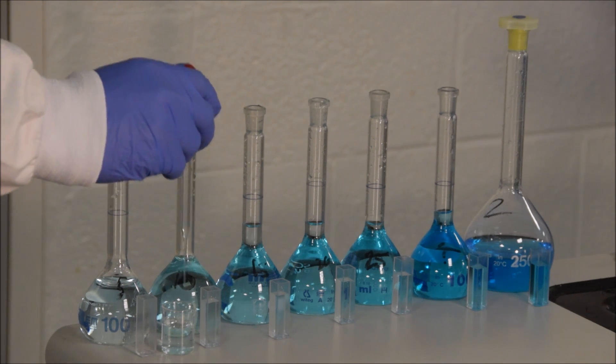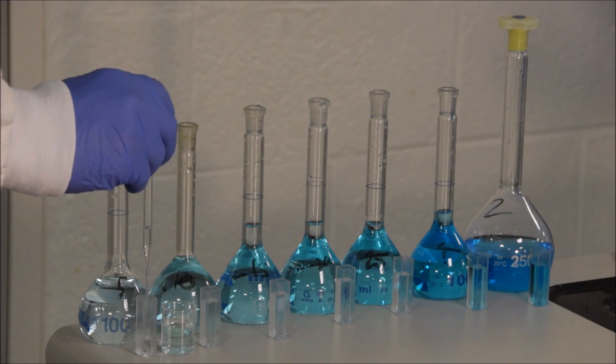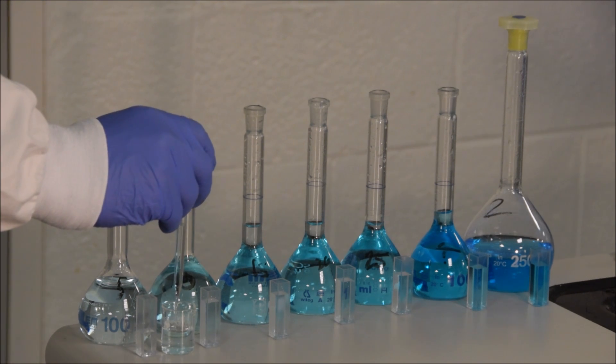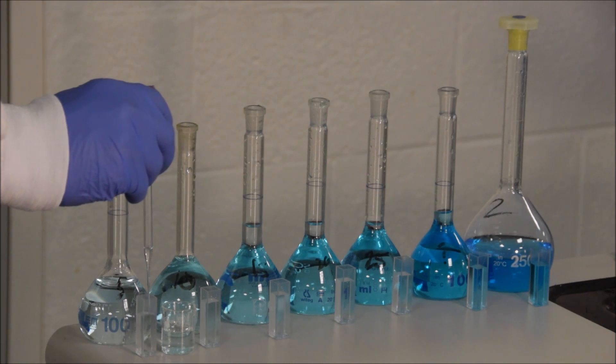To do that we take some of our material that we prepared and we place it into a cuvette. Never transfer directly from a volumetric flask, always transfer it into a beaker or another container first so as not to contaminate the source material.